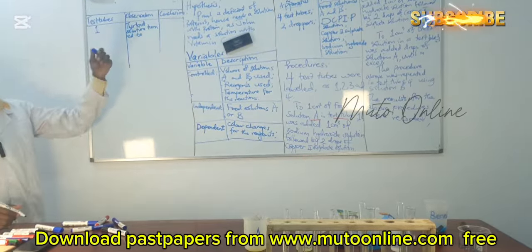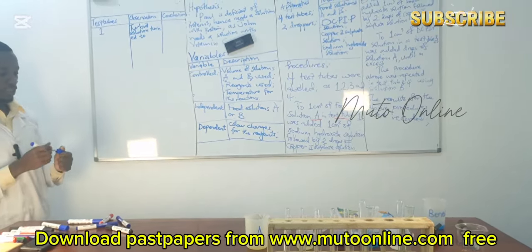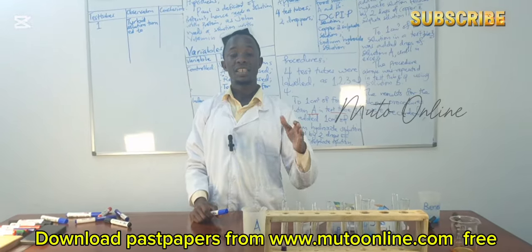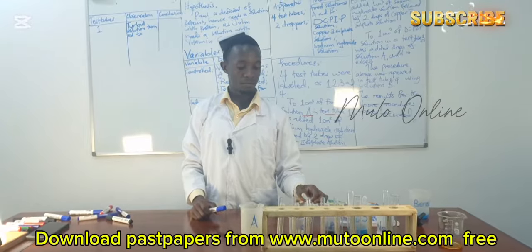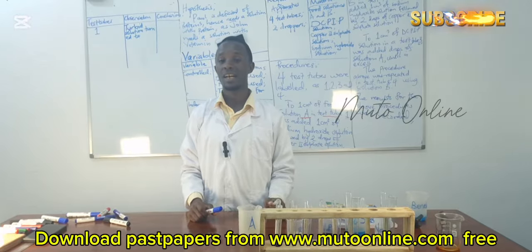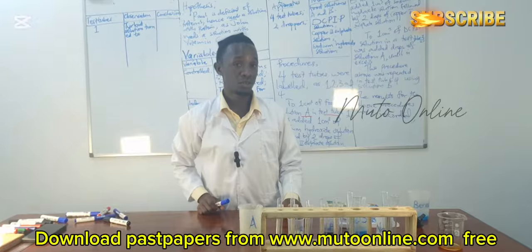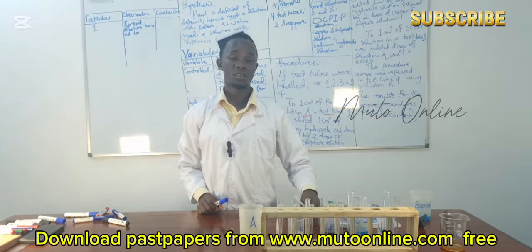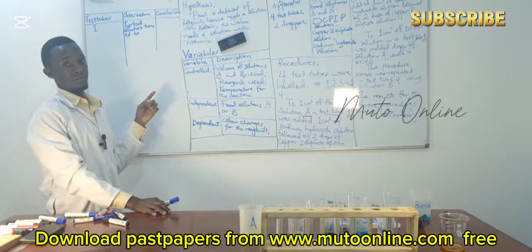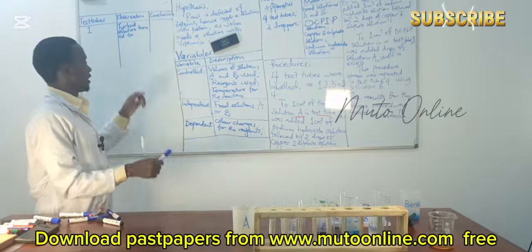You are reporting what you did. So when do we write turbid? We write turbid when the solution is actually more thick than water, irrespective of the color, so long as the viscosity of the solution is more than that of water. So we write turbid. So it was a turbid solution.